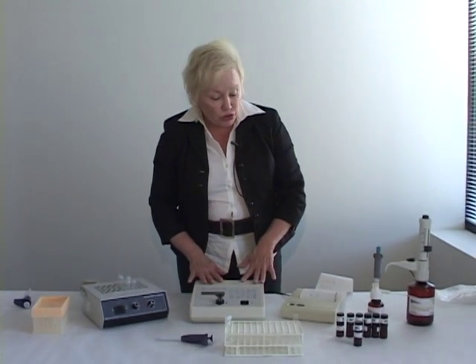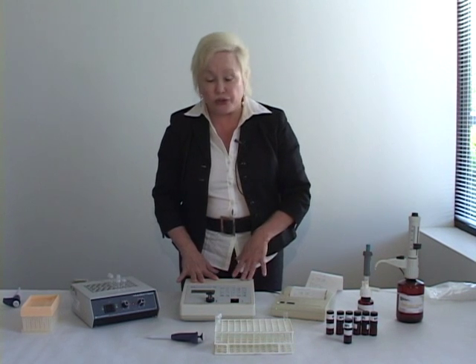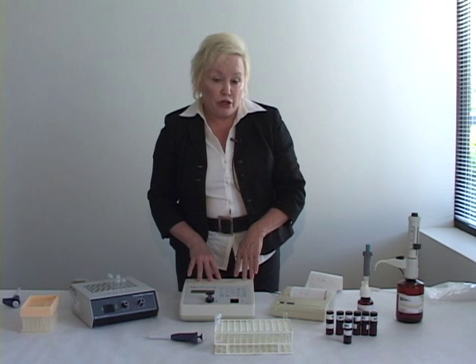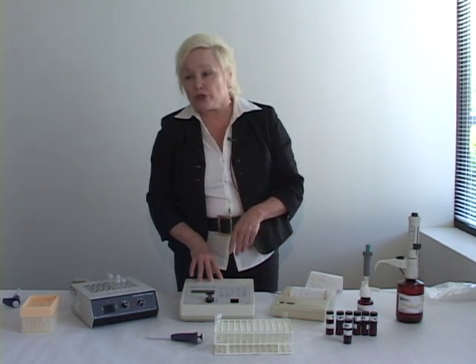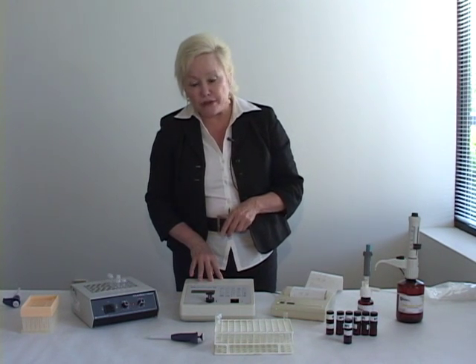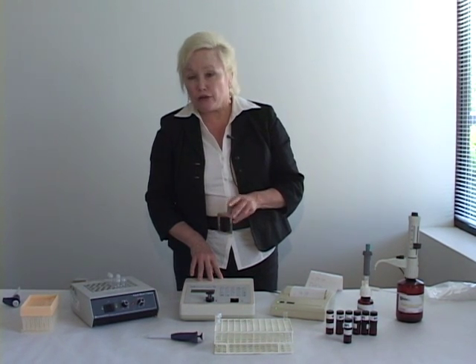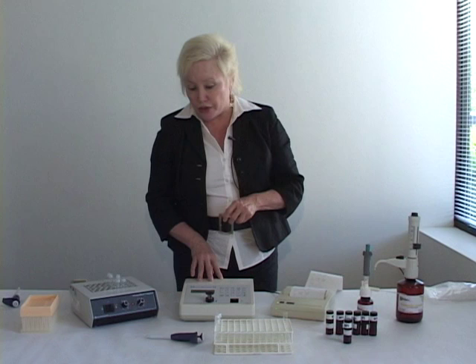So we have learned how to set the heat block, use the instrument and printer, and use our test kit and pipetters to measure total glycerin in biodiesel test samples. These measurements can be made any way, any time during the reaction, even with catalyst present and even with water and methanol present. So you can truly monitor your reaction as well as measure total glycerin in your storage tanks over time to look at quality and stability changes on storage.